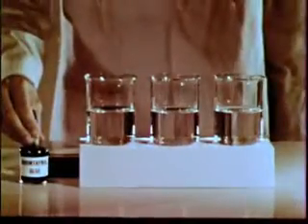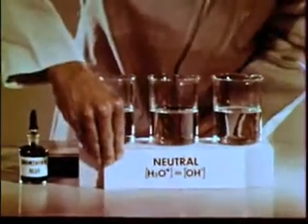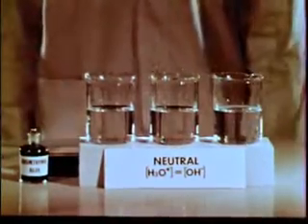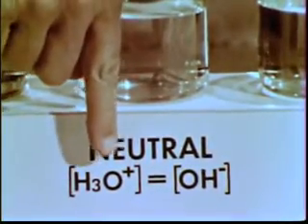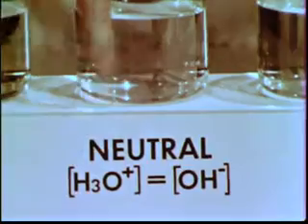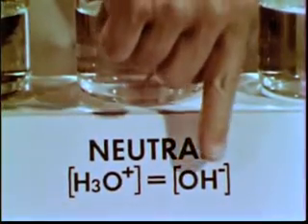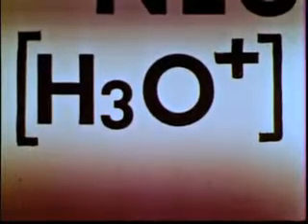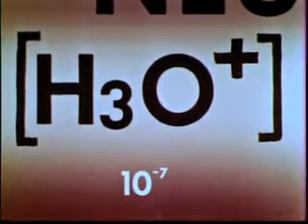Here are 3 beakers containing pure distilled water. Pure water is said to be neutral. In a neutral solution, the concentration of aqueous hydrogen ions equals the concentration of hydroxide ions. The symbol H3O+ represents aqueous hydrogen ions, also called hydronium ions. Their concentration is 10 to the minus 7th molar at room temperature.